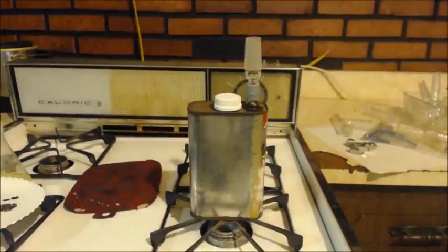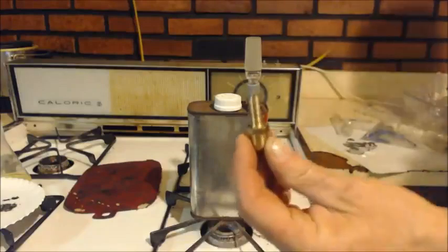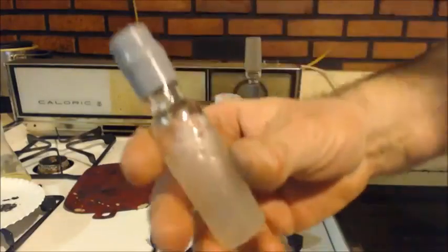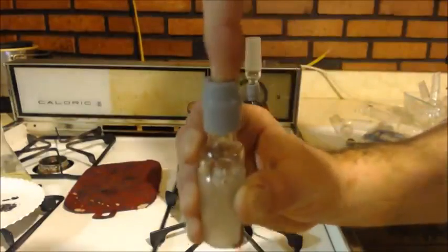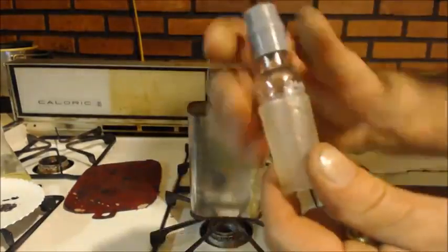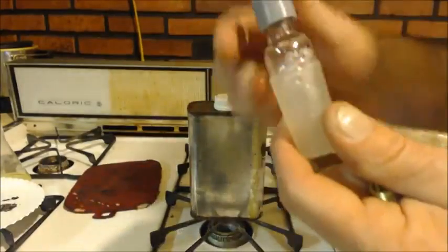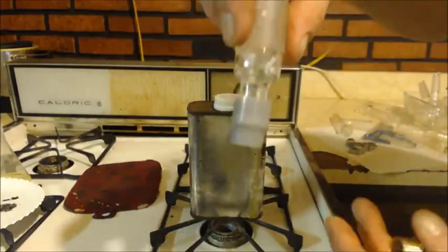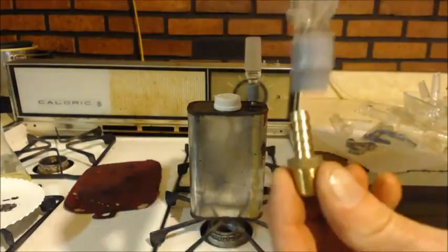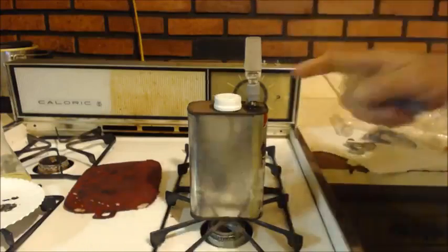I lost the footage, but first, remember this is the bottom part, right? I got one of these. This is for a thermometer. You would put your thermometer through this hole here, see? And then you got your ground glass joint, right? Basically, I'm just turning it upside down, and I'm going to jam it into this until it looks like that.